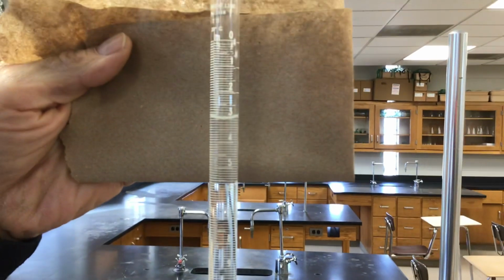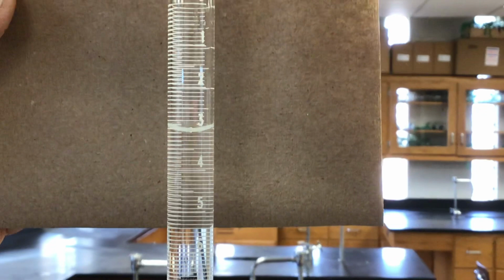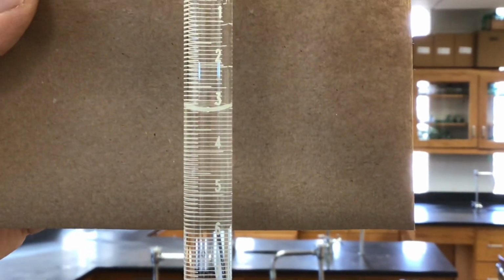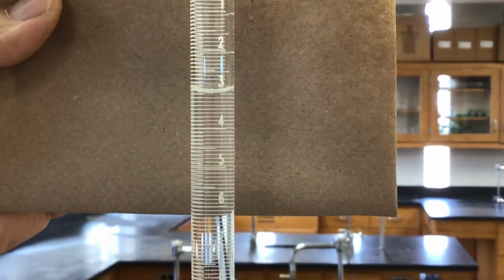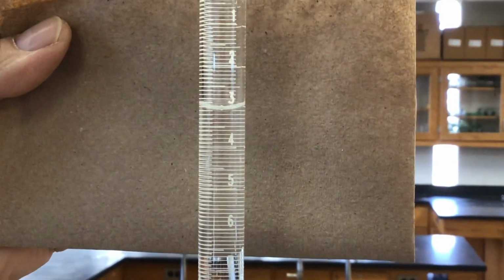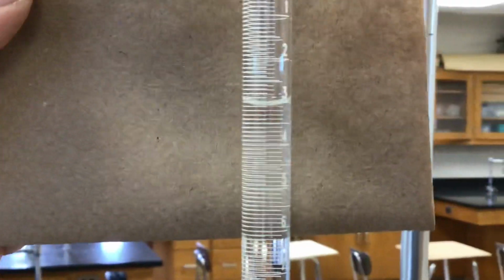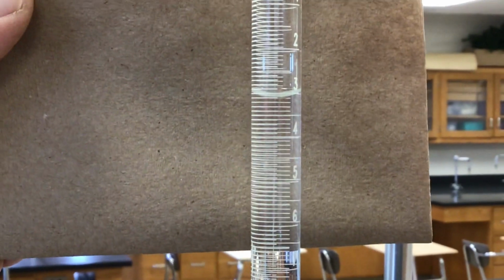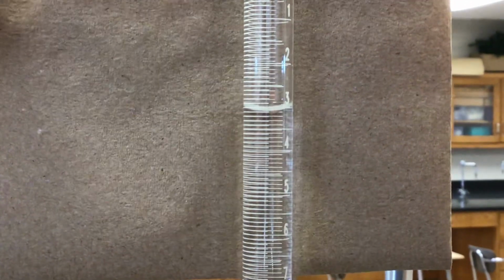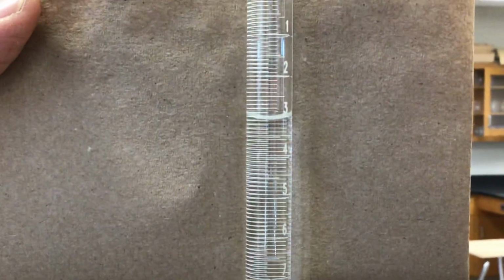Okay, I'm going to zoom in on that. So don't subtract from 50. I know that you're going to be tempted to say, well, we need to know how much liquid is in the burette. Just read it. It's between 3 and 4. I'll move this over a little bit so you can see what the graduations are. Okay, so try to go to the hundredths place. And now this will be the initial volume for our second trial.